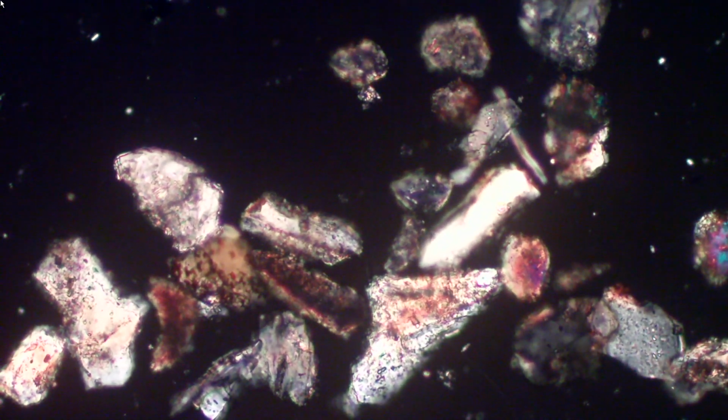Now, what that does is when you're analyzing a field of particles, if you want to see all the particles that are birefringent, you have to periodically rotate the stage. Every time you change field, you've got to rotate the stage so that you can identify the particles that are birefringent. Well, what we're going to be doing today is setting up a system where the birefringent particles always show their maximum birefringence for the particular position they're in on the stage.